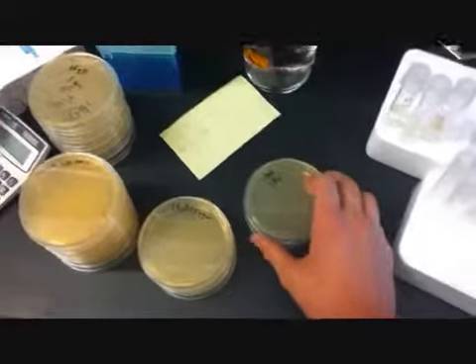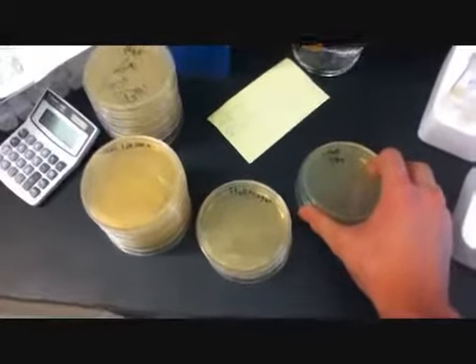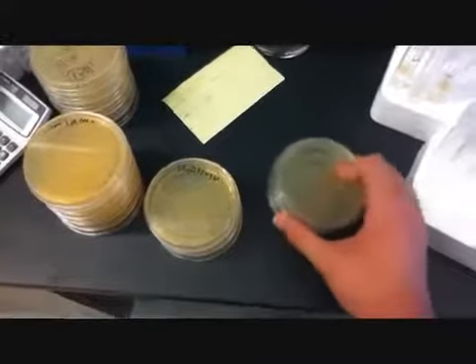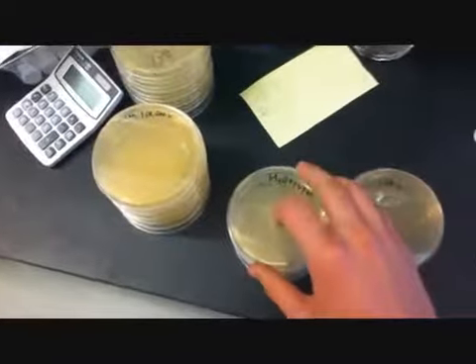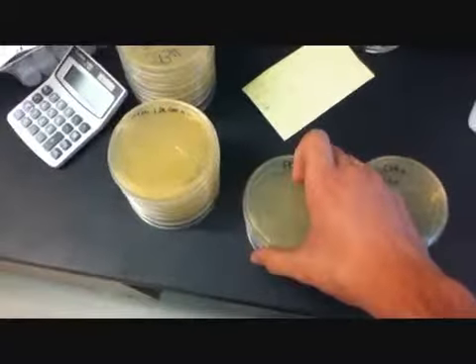H2O and sugar, 1x. Now, I couldn't tell how much bacteria was in the Coke because it was darker, so we just had 10x and 1x. So there's a 10x dilution and the pure Coke that we originally had. The reason these only have 1x is because they didn't appear to have very much bacteria, but we don't know for sure yet until we actually grow them.